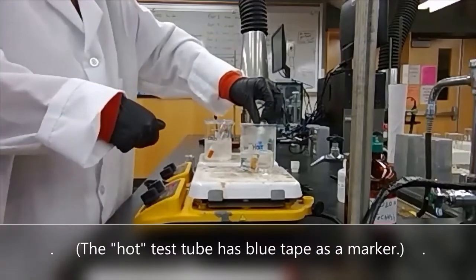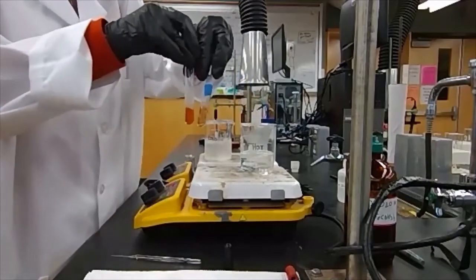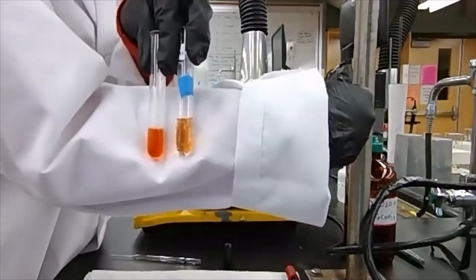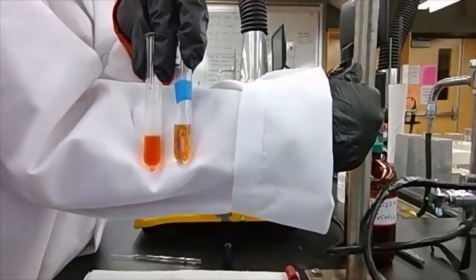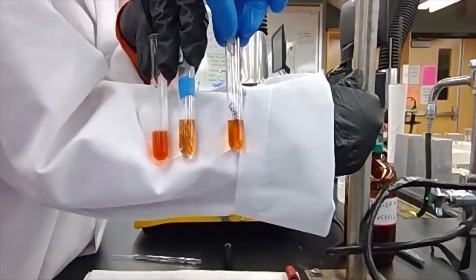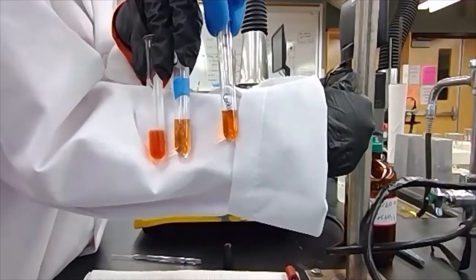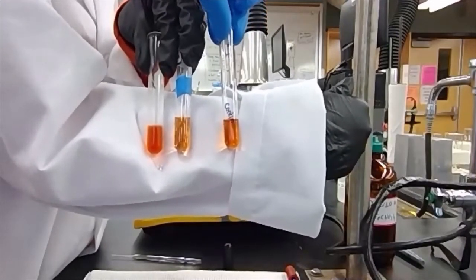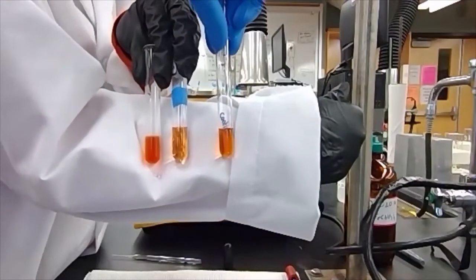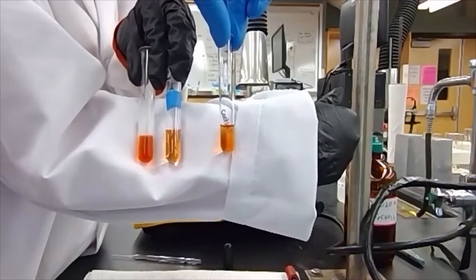So in the hot and cold we have here, again, the one with the label has the blue, that is the hot one, and there is our control as well. Now it is a bit difficult to tell the difference against our control this time. So what we're going to do instead is look at the hot versus the cold.